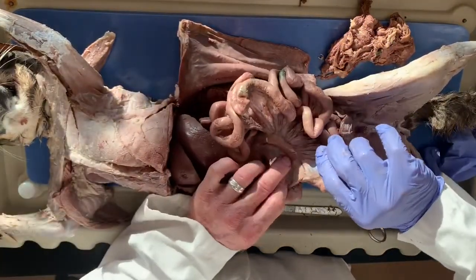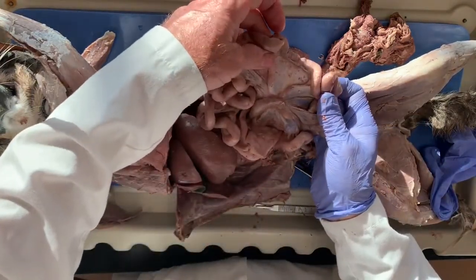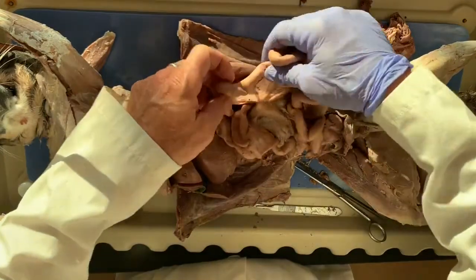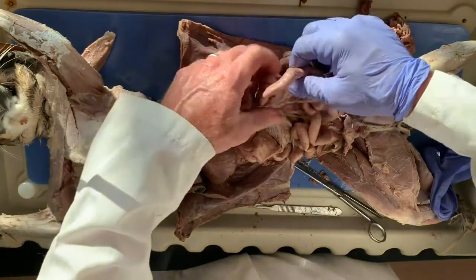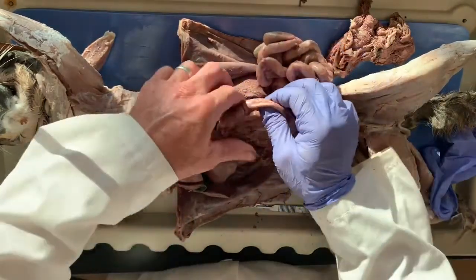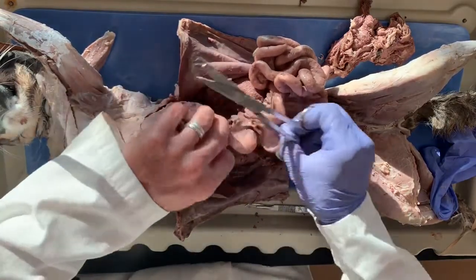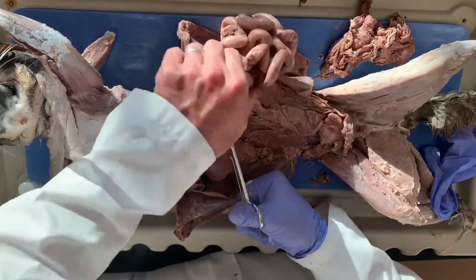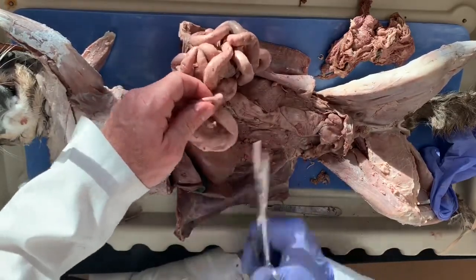And then you'll see these little nodules, which are lymph nodes, sometimes called Peyer's patches, within your intestinal tract, okay? This is all small intestine. Remember DJI. The duodenum, the jejunum, and the ileum are the three parts. So we have our end here, and now what I'm going to do is kind of break free all the intestines from the mesentery, okay? So I just kind of start in one place, and then make my separation all the way through.